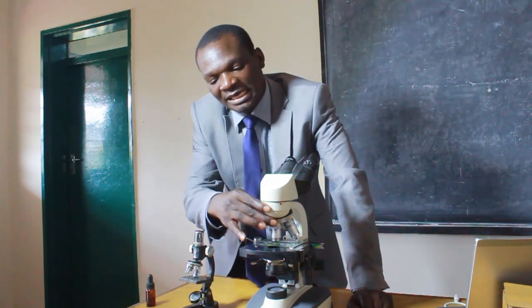The body tube is a tube on which the eyepiece lenses are mounted on one end, and on the other end you have a rotating nosepiece. It is on this rotating nosepiece where other lenses are mounted. The rotating nosepiece is called so because it is able to rotate, and this is where you have different lenses attached. These lenses are also convex lenses. They are called objective lenses because they are near the object — the object is the specimen you are going to observe under the microscope. They also magnify the image of the specimen.